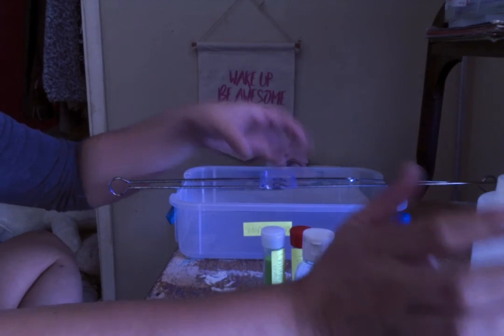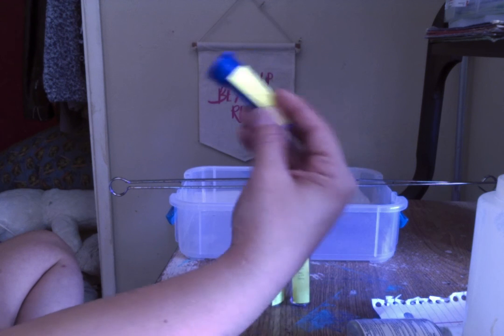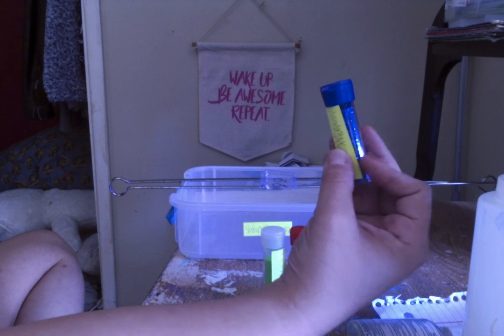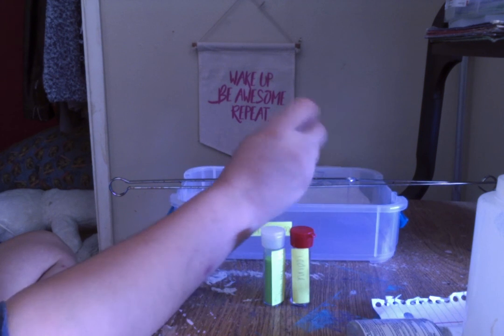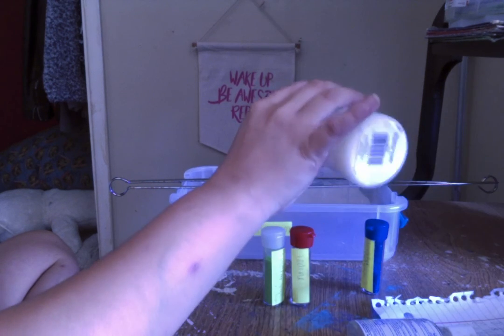And after that, you're going to use the counterstain safranin, which will turn it pink in color to better help see and view and make data of. And so you're going to put this on there for a minute as well. And then you're going to rinse it off with water.